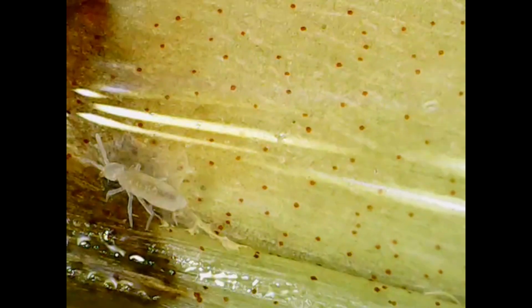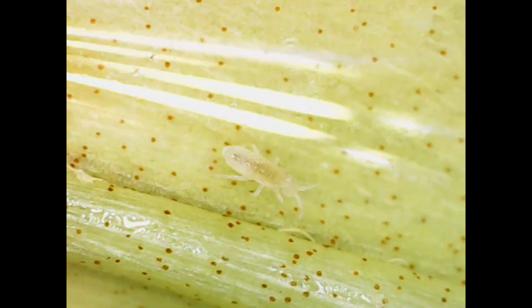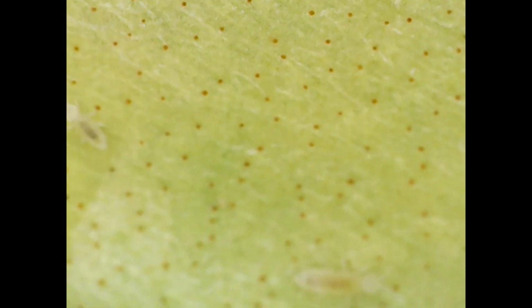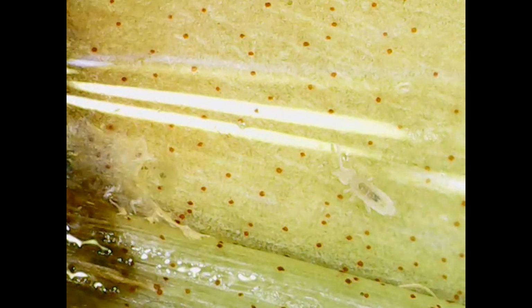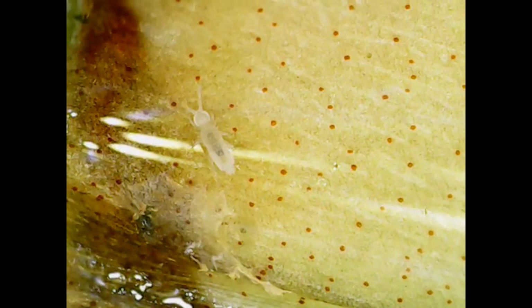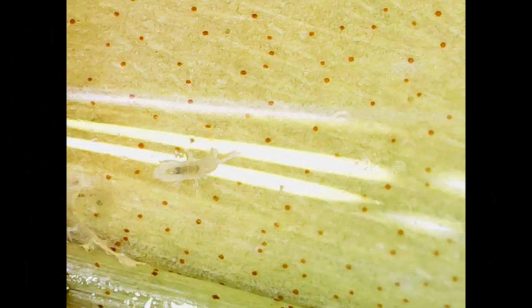Let's have a look. So there you go, you can see what that springtail is. I think this is just on some random bit of leaf that was potentially dying, but I was able to capture it. There's a little baby springtail there as well. Again, apologies about the focus, but these things do not stay in one place. And if you've ever seen springtails move around, you know that they are exceptionally active. They're very good caretakers, especially in soil, because they will essentially eat decaying matter. So I always find it quite useful to have them in some of my soil mixes. But yeah, you can see here how they're moving around, and you can imagine that happening in the actual soil level itself.